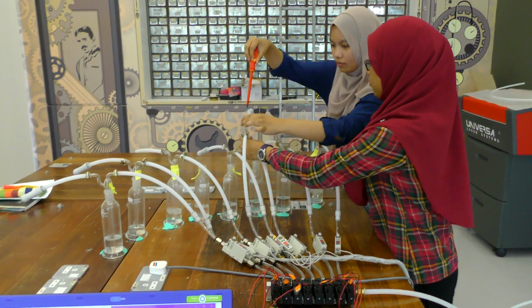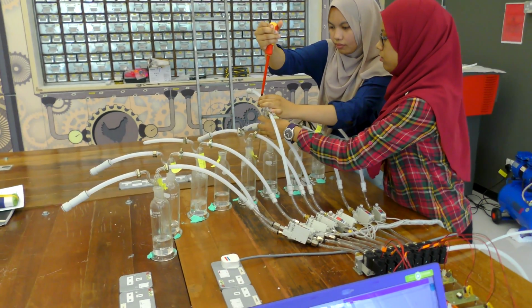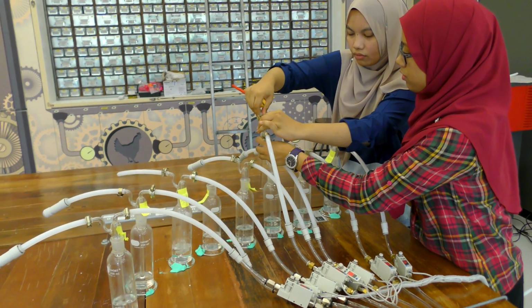So we use 8 glass bottles. Inside seven of the glass bottles, we put seven different liquids that have different smells. And another bottle contains pure air to continuously flow to the subject's nose. My partner Hamizah Shahroom will be explaining in more detail how to operate this device.